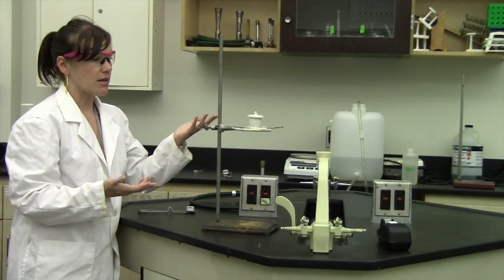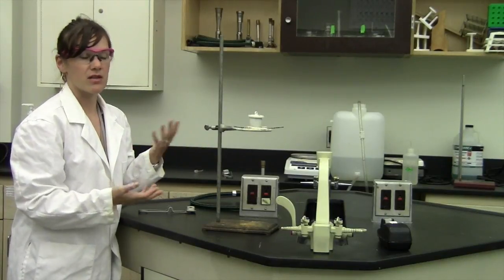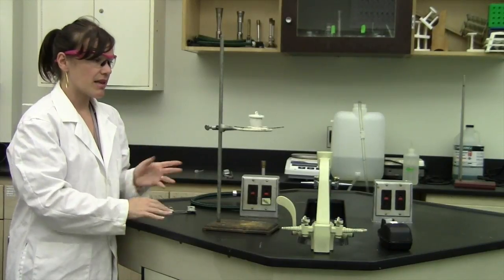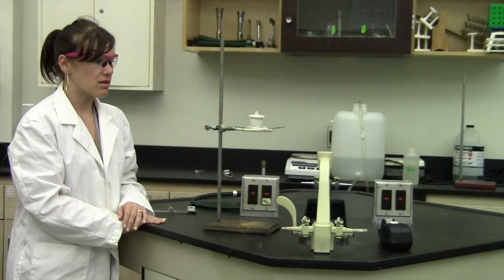Also, whatever it is that you're doing may or may not require a lid, so the particular lab would tell you whether or not the lid is required. But that's the idea of how to set up a crucible and a clay triangle.